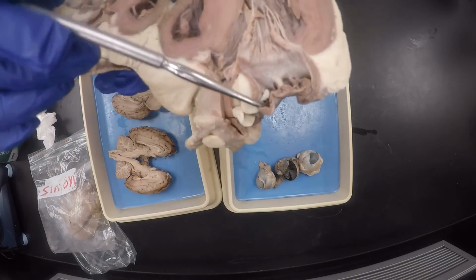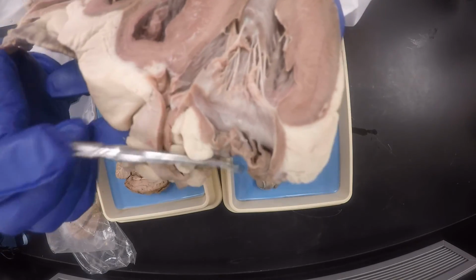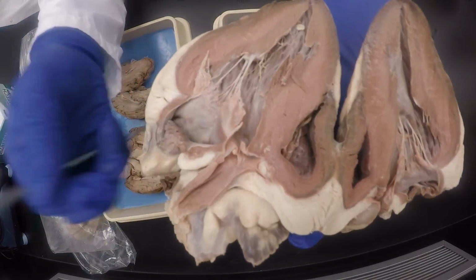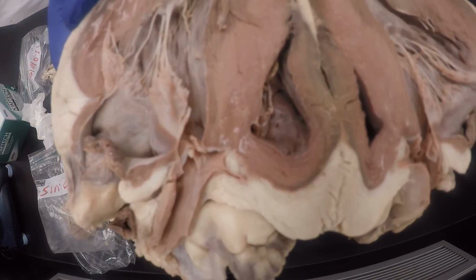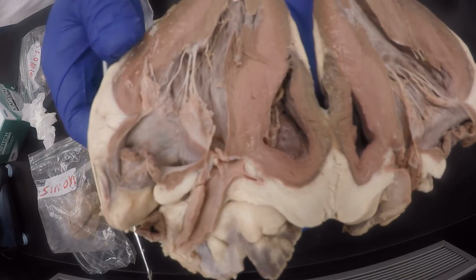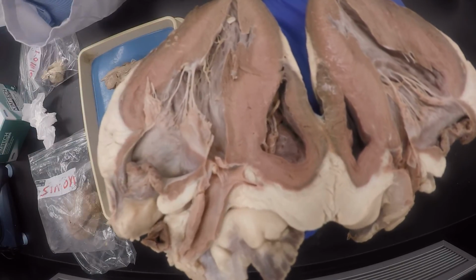If it's in the auricle, do you see these little muscular ridges over here? And you could see them over here too. You see them? Those ones are called musculi pectinati. Okay, you can also call them pectinate muscles if you want to make it simple for yourself. Okay, pectinate muscles. Okay, these ones in the auricle.